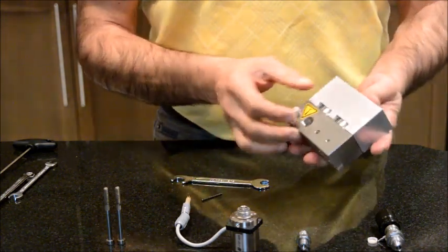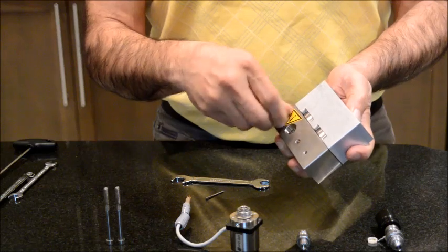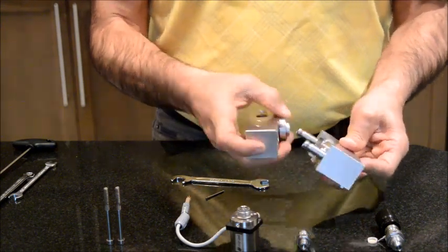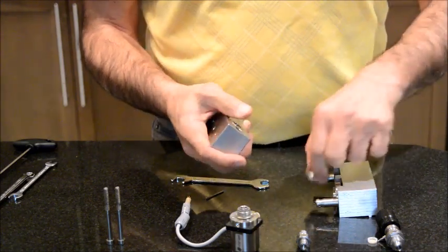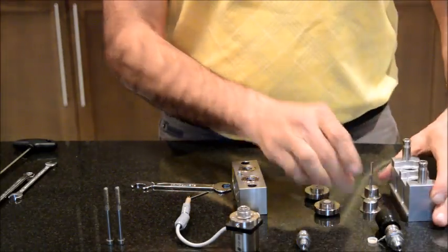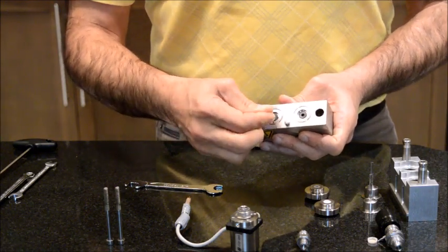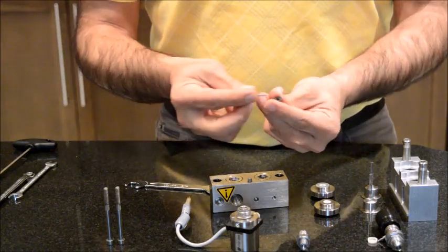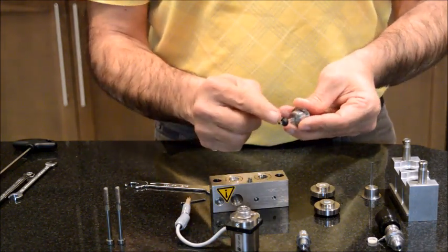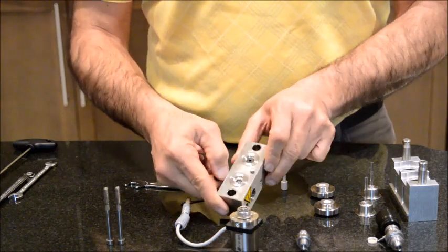So the pump seals are worn out and they need to be replaced. Now to open this up, you have to unscrew this thing. It will become separated from one another. These are my pump pistons, and the pump seals are these black pieces inside. Over time, these pump seals start to lose the grip that they are meant to have on the piston, the grip is gone, and they start to leak. So these are the consumables again, and by replacing them, you will solve your leak in the pump.